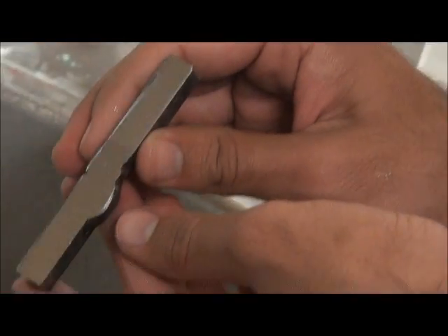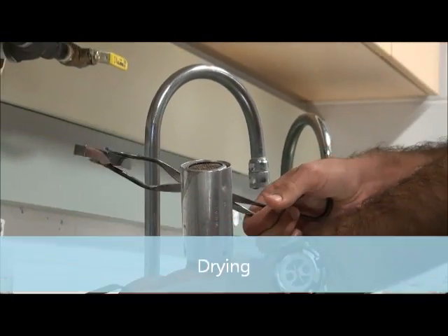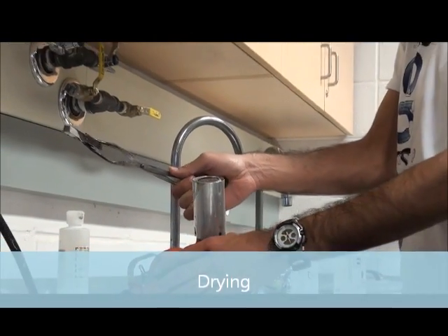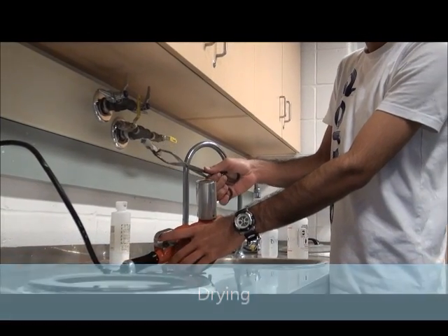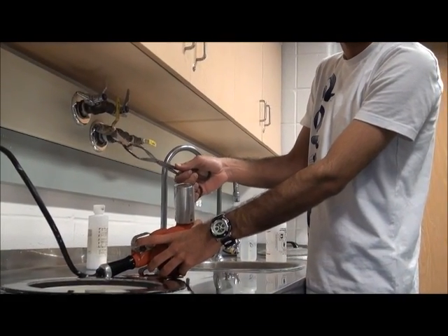Now we have to dry the sample. Make sure you use the extension because the air from the dryer is very hot and could harm your hand.